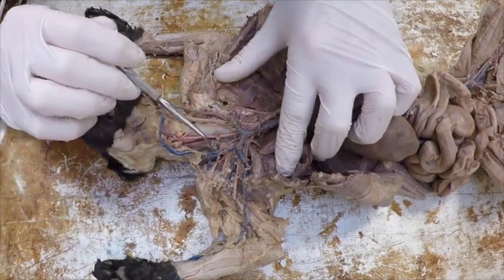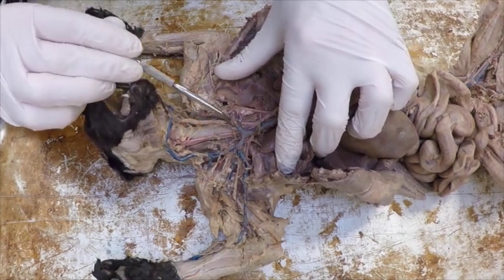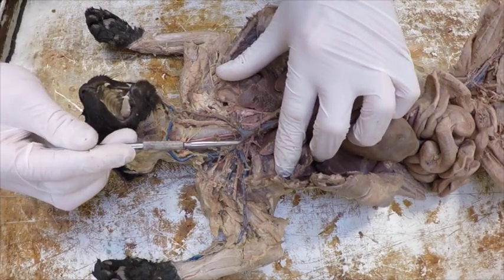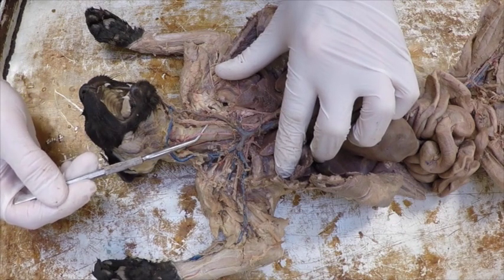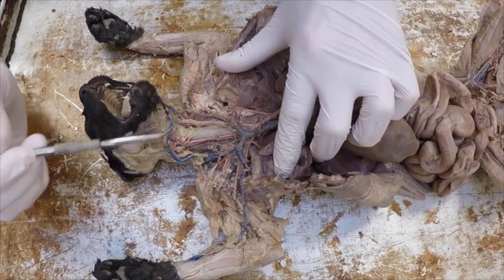If I bounce back towards the neck, I don't see their internal jugulars, so they don't have those, and there's nothing we can do. Veins tend to inject a little bit larger because these are thin-walled vessels. Arteries don't get quite as thick because those are really thick-walled vessels, and so we can't get as much latex to go into them.